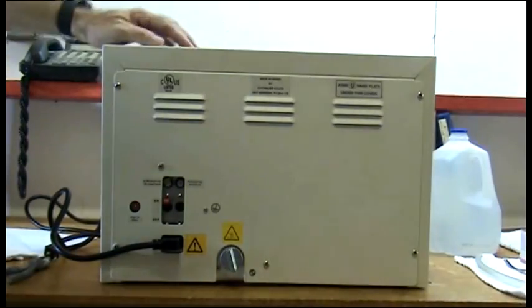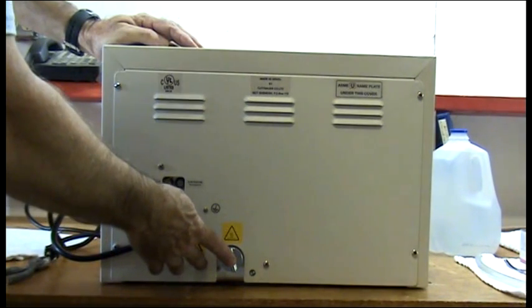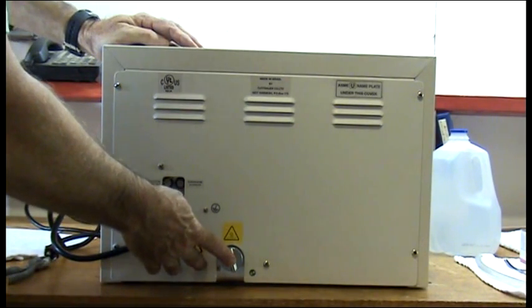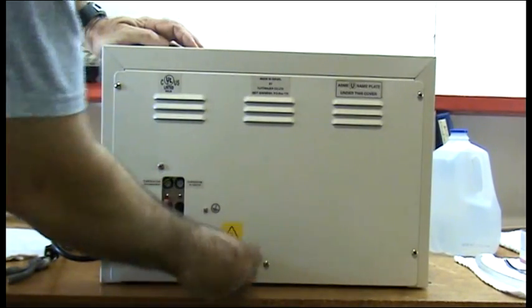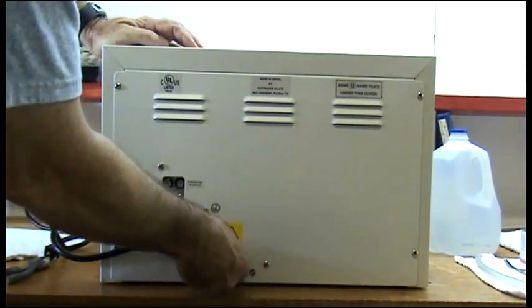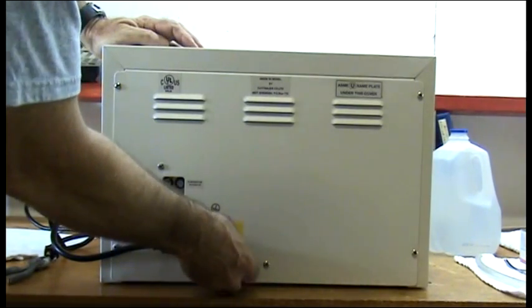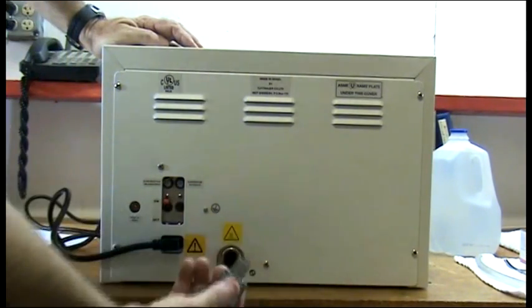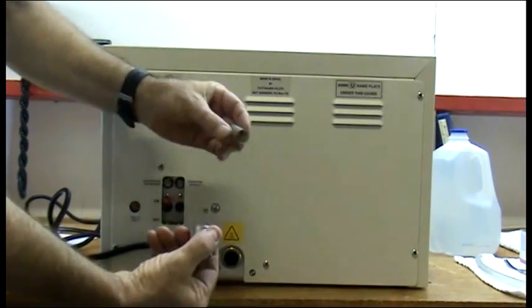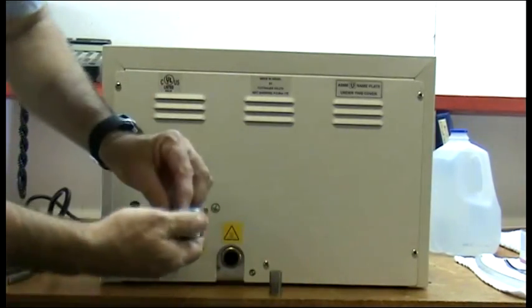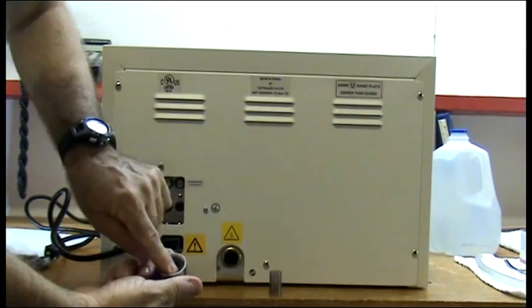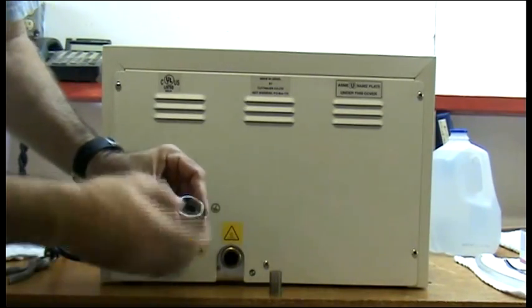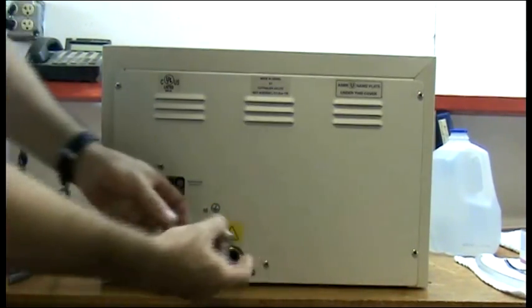In the rear of the unit is a strainer valve. This should be cleaned about once a month. We've turned the unit around to make it easy to see. With the machine cold, because this unit will become very hot after the unit operates, you'll see the strainer, a gasket, and the top. Be careful of the gasket; they do fall out.